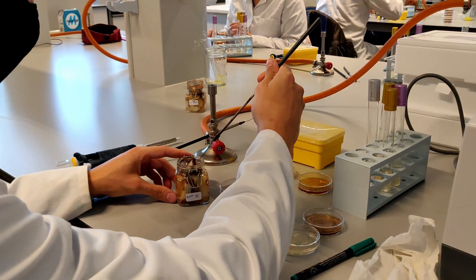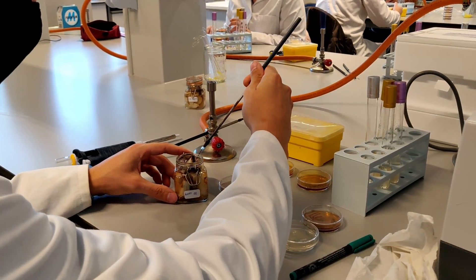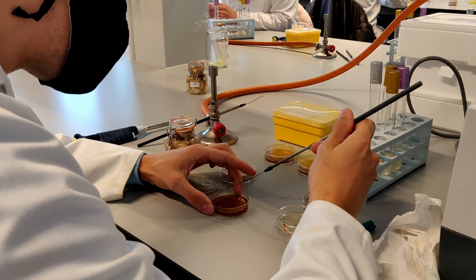In this process bacteria like Lactococci will reproduce anaerobically in the jars using the artichoke as a substrate. A week later I took some samples from the jars and plated them on MRS media, on which Lactococci specifically grow very well.